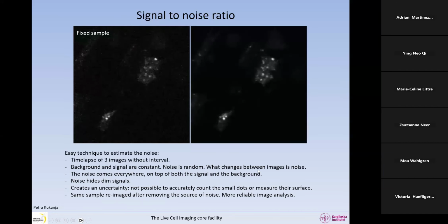So after changing the settings on the microscope, and I will show you what you need to change to get there, you can see that now this is also a little time lapse. There's very little that changes from one image to another. So we got rid of the noise. And what we can see now is that here we had 2 dots. This was absolutely impossible to see in this image, which was noisy. Okay, so if we remove the noise, we can then enjoy the resolution of the objective in this case. The noise can come from different places as well, and it's important to know where it comes from so you can deal with it.